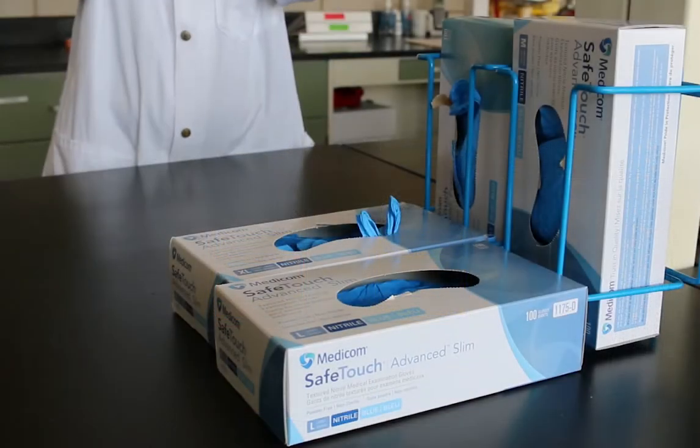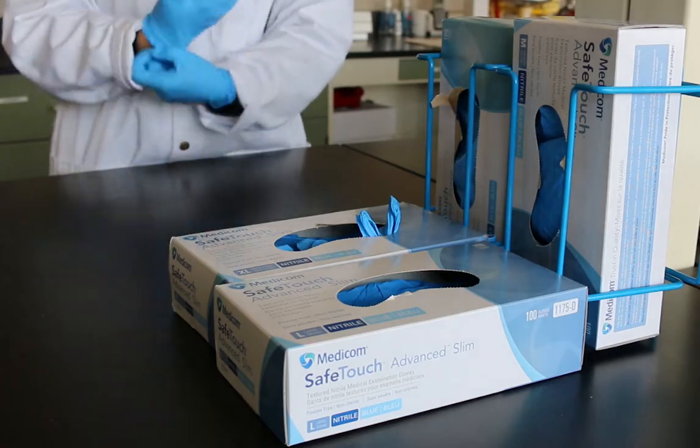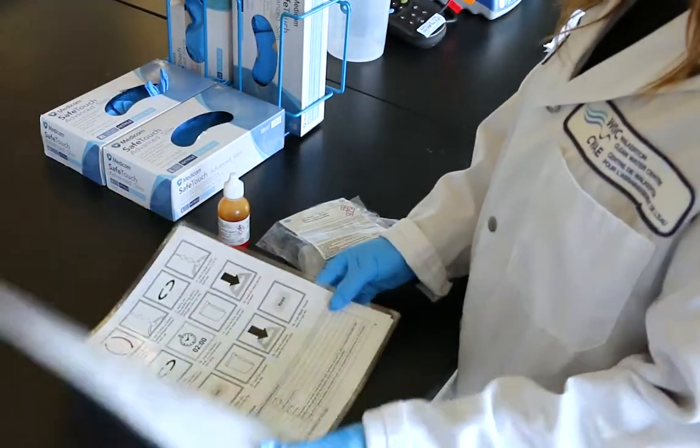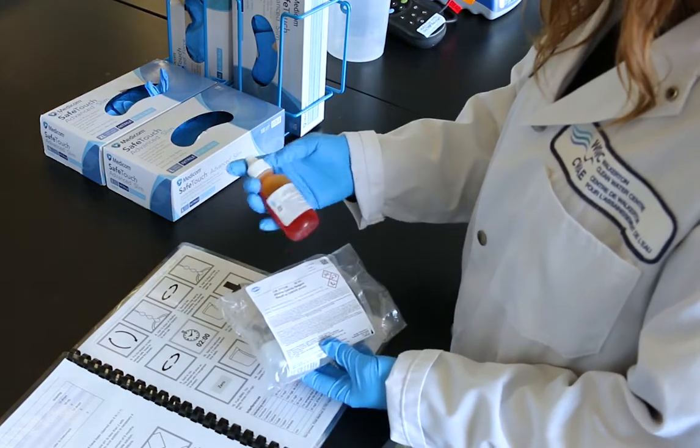Be sure to review safety data sheets for the reagents and use the personal protective equipment that is recommended. The alkaline cyanide reagent contains cyanide, so be sure to follow all safety precautions.